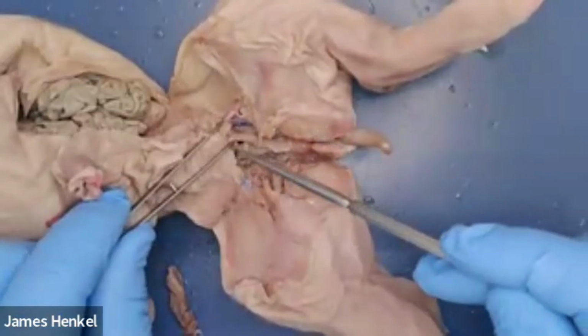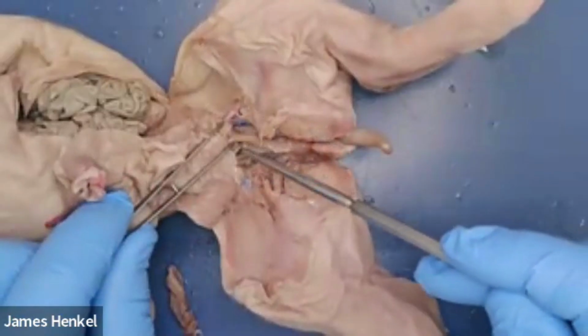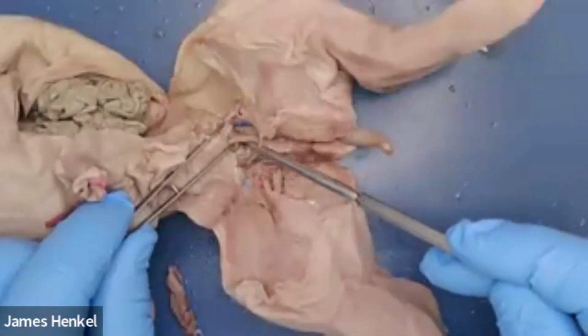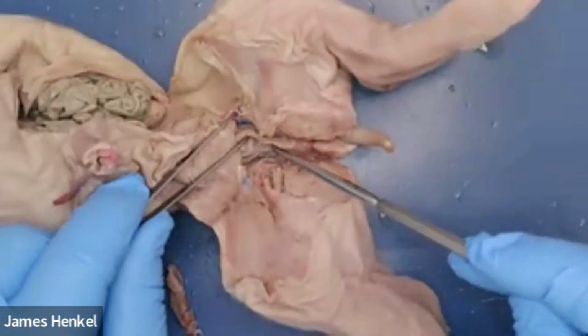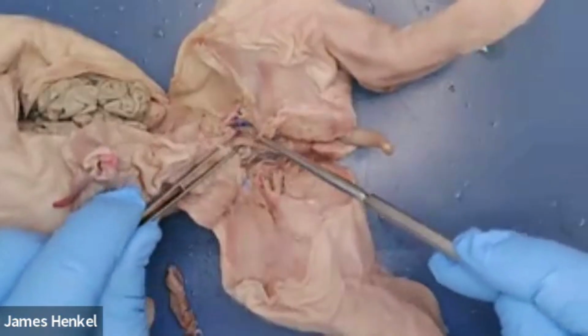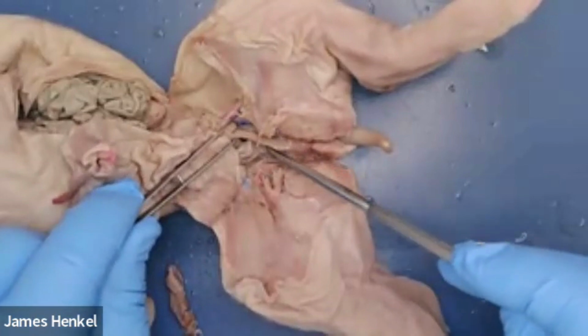And that harder membrane, when you see that ridge there, that's the cervical opening, cervix. And it's a really nicely shown one here where you can see there is actually tissue differences. And that's the vagina I'm pointing at. So it's not external, it's internal. So we have the cervix and the vagina there.